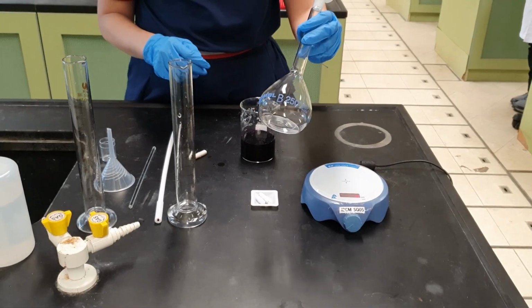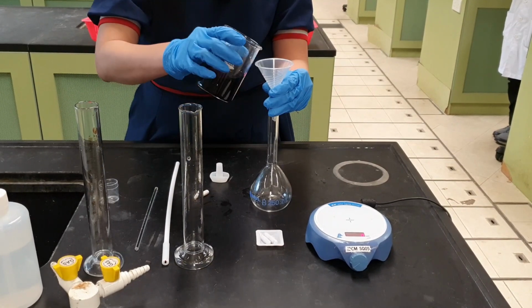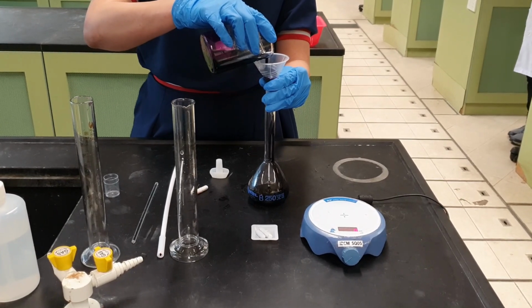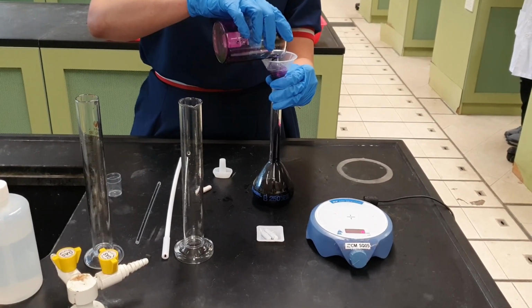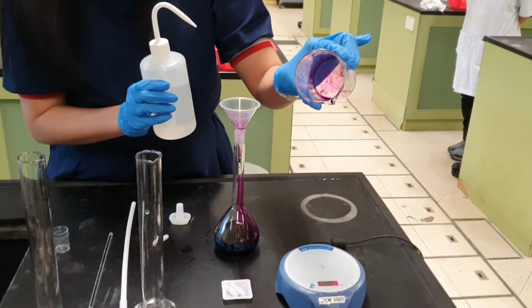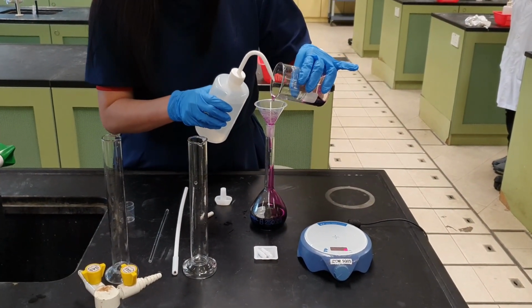Next, transfer the solution into the volumetric flask using a funnel. At this point, double-check that there isn't any salt left in the beaker. Rinse the beaker at least 2 times with distilled water to transfer all the chemicals into the volumetric flask. After that, rinse the funnel with distilled water.